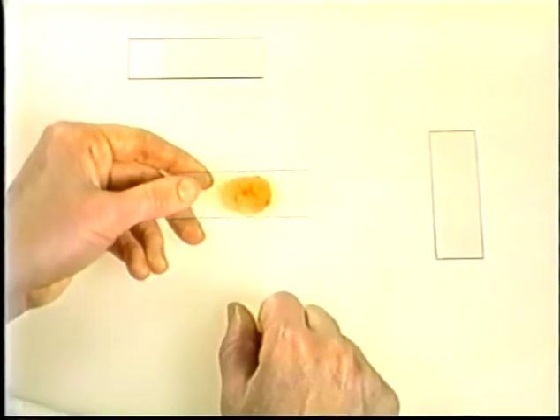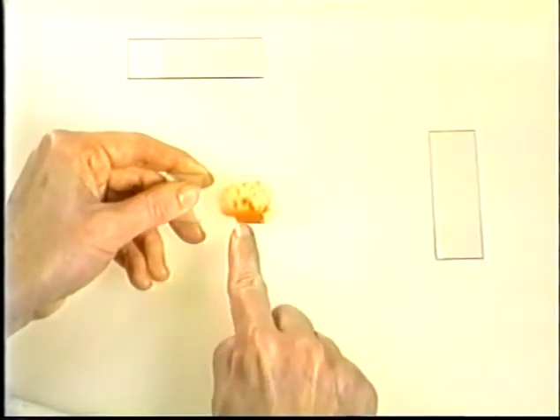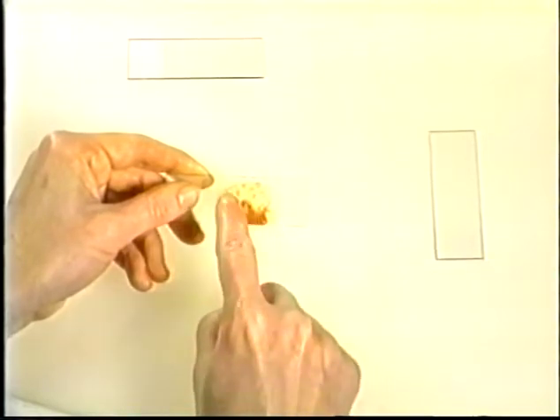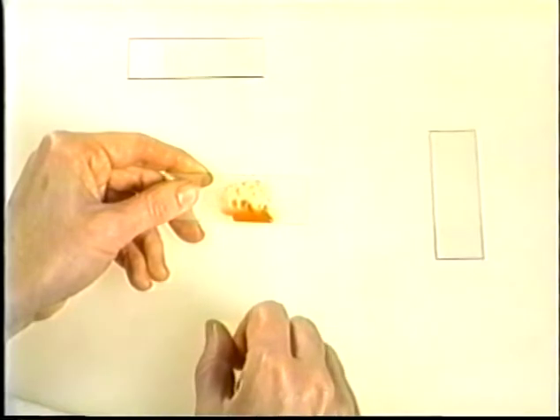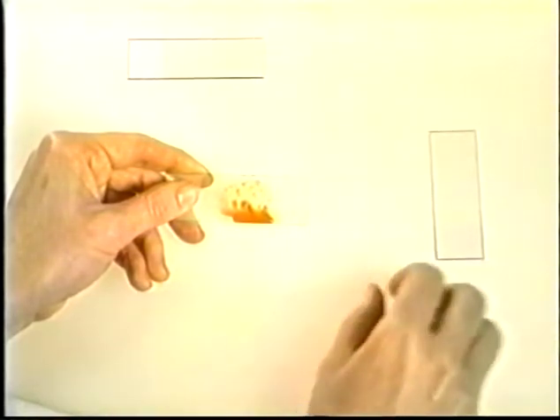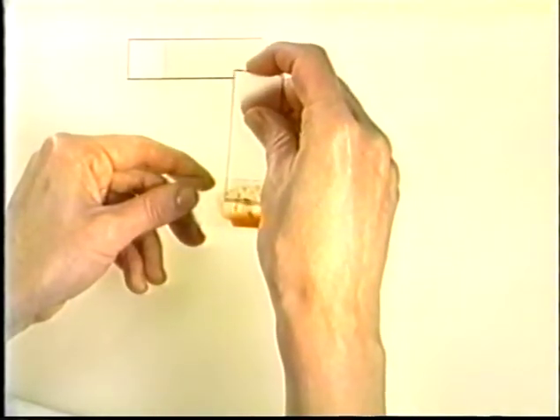Now tilt the slide sideways. This will make the fluid collect along the bottom edge and leave the fragments exposed over the rest of the slide. Keeping the slide tilted, use the short edge of another slide to transport off a few fragments.